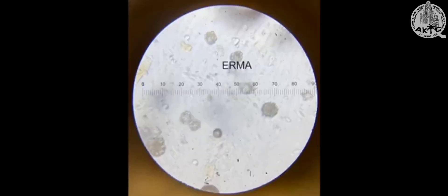We have to take at least 20 readings in S form. For that, adjust the slide by stage controls by moving them in S shape. Here we got 10 as our diameter. After that, we have to find the area of each crystal by using the formula pi r square. We got 10, and then from pi r square we got 78.5.